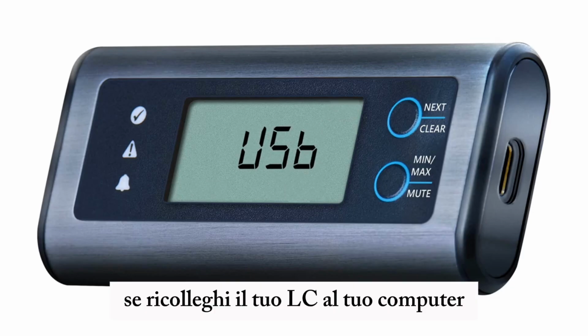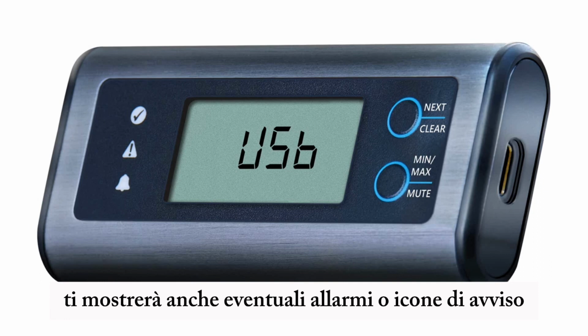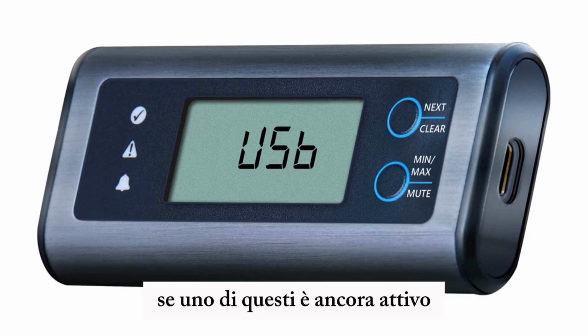If you plug your EL-SIE back into your computer, the display goes back to saying USB, although it will also show you any alarms or warning icons if any of these are still active.